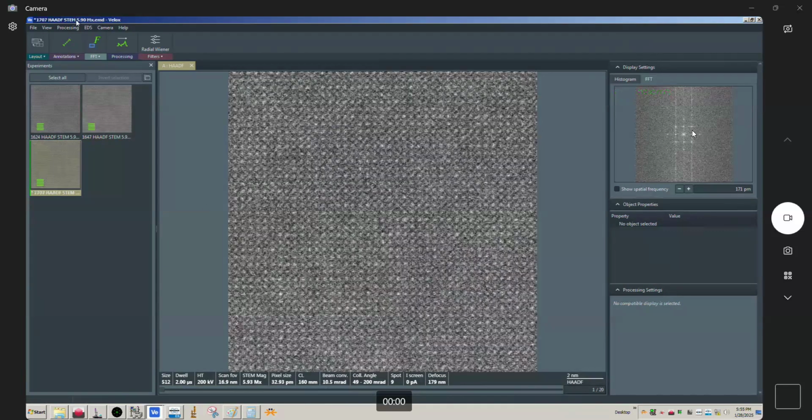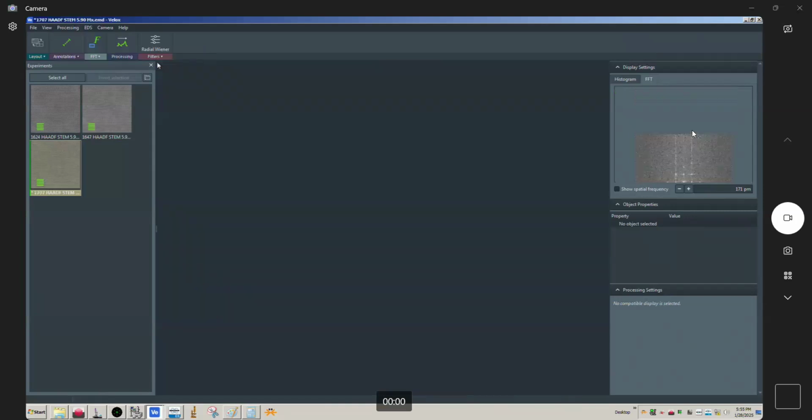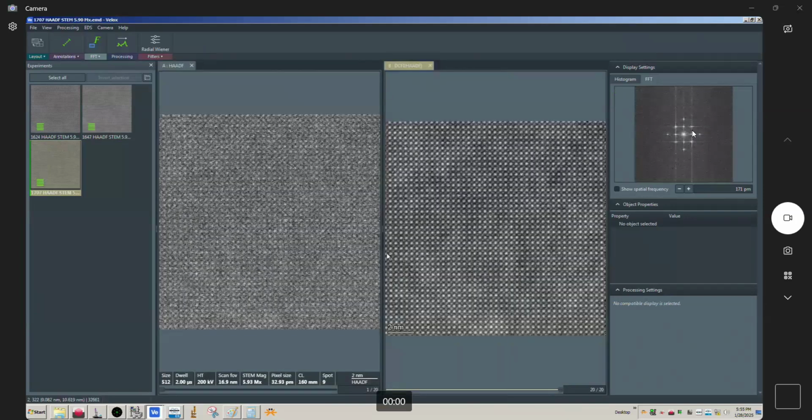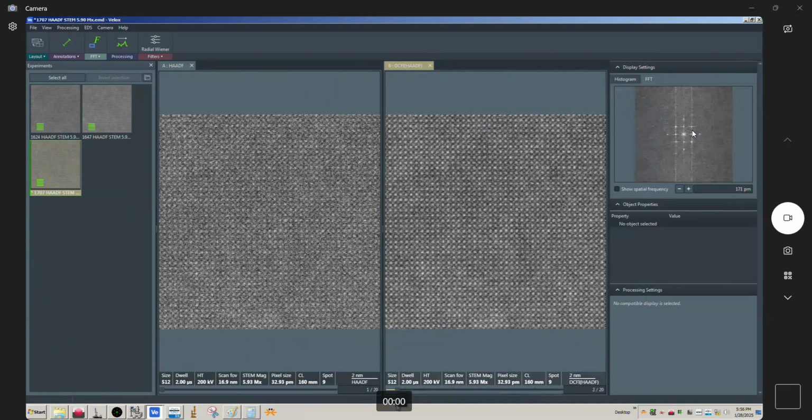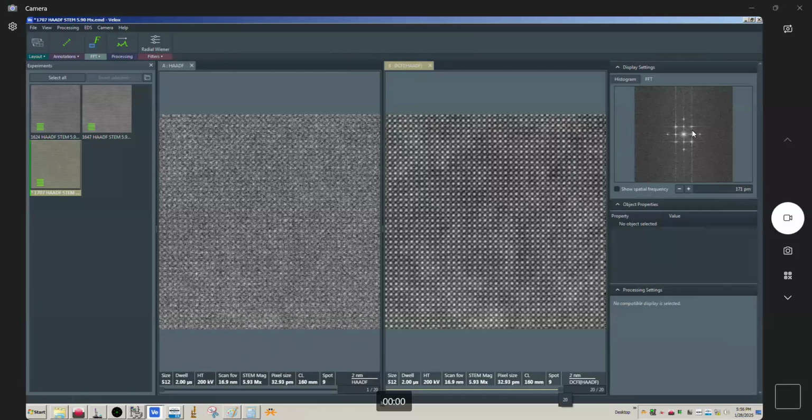So now, let's do the frame integration. And look at that, okay? This looks much better than what we were getting at 1K by 1K. Okay, looks much better. If you look at the FFT, I'm actually seeing better detail in the FFT here than I was at 1K by 1K, right? And if we actually cycle through each of the frames here, you can see those are adding together really, really well. Okay, again, this is non-corrected, right? So it's not going to look as good as what we get in a corrected tool, but you can see how well this works, or that this can be effective.